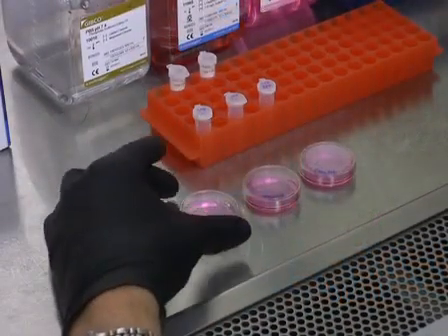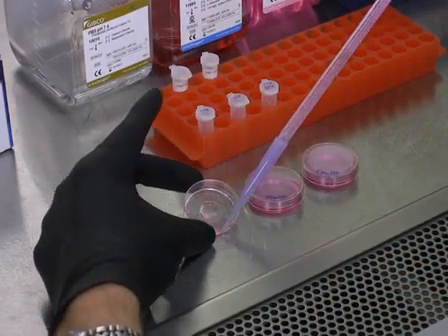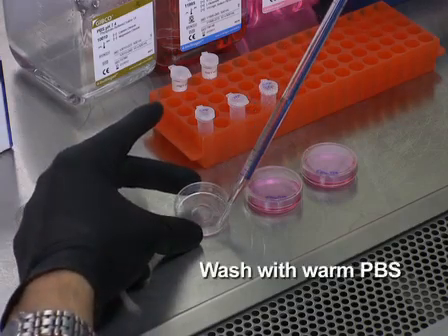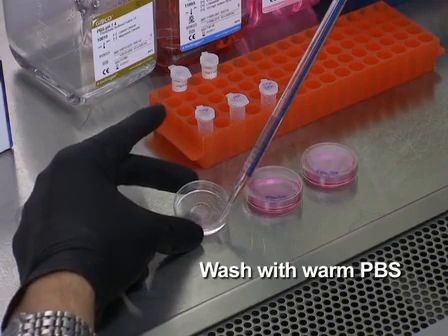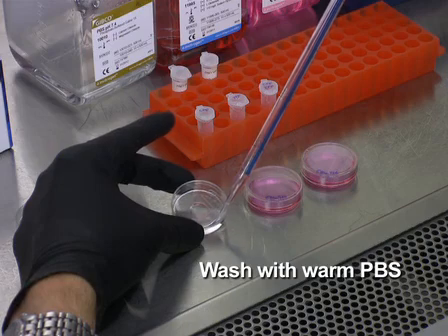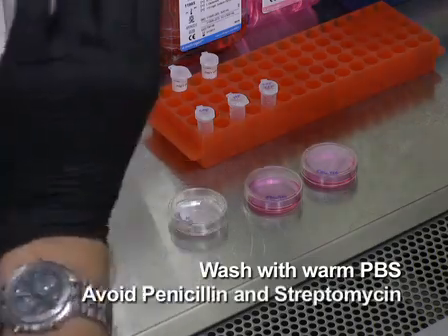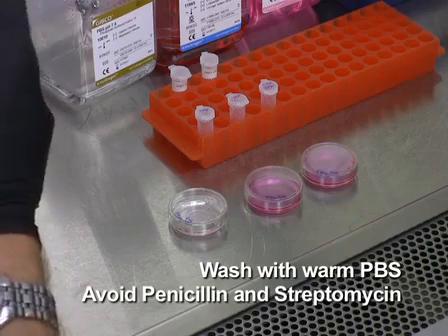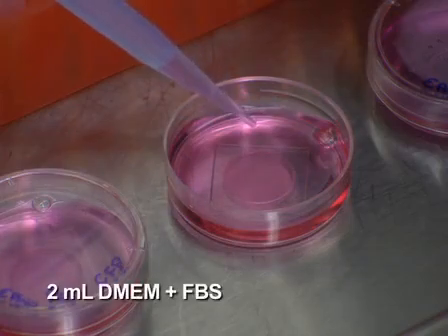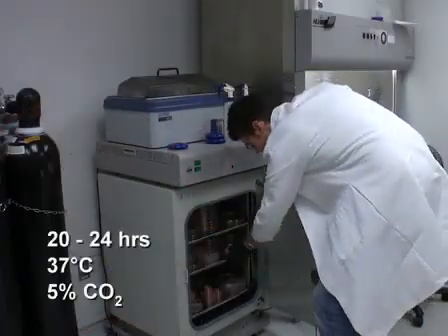During the incubation period, prepare cells for transfection. Aspirate off the media and wash each plate gently and briefly with warm PBS before the addition of 2 ml of pre-warmed complete DMEM without antibiotics. It is important to avoid the presence of penicillin and streptomycin as they are considerably more toxic to cells during treatment with FuGENE HD. Add the complex dropwise to cells and incubate for an additional 20 to 24 hours.